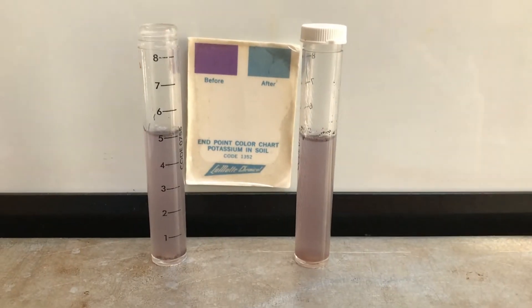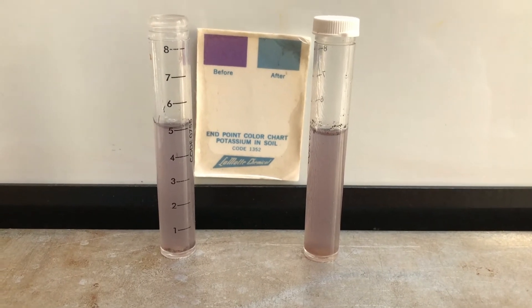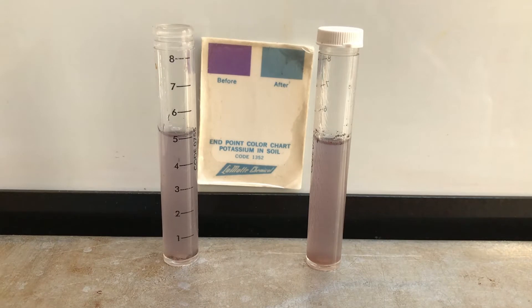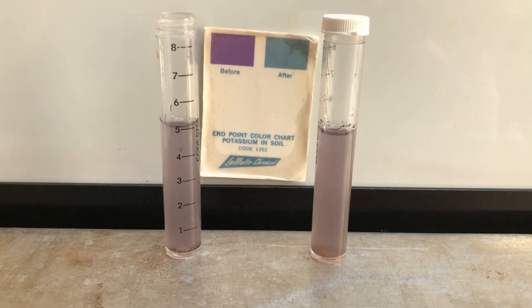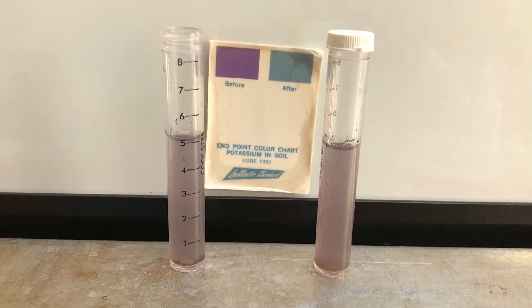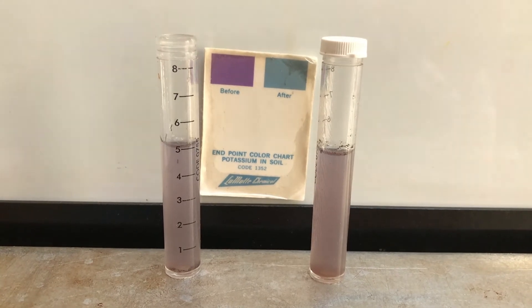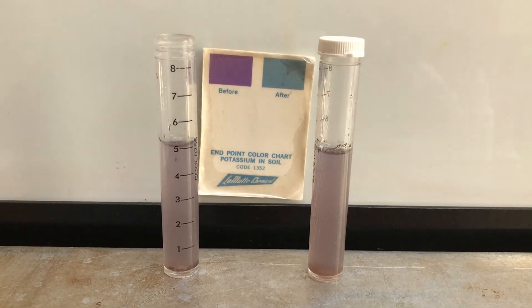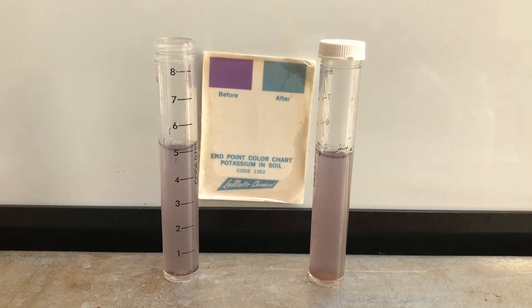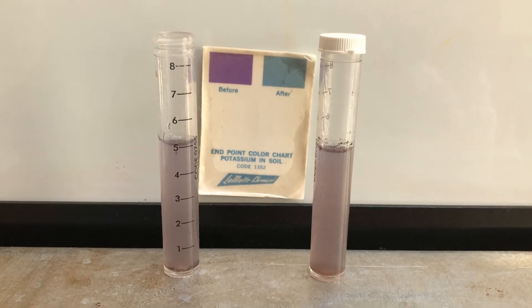Okay ladies and gents, we have finished our potassium extraction. We pipetted the extraction solution, which should contain the potassium, to a second test tube. Then we added our potassium test tablet and shaken our test tubes until they're fully dissolved. Now it's time to actually determine the level of potassium in our soil samples.